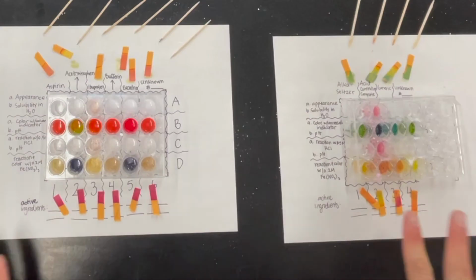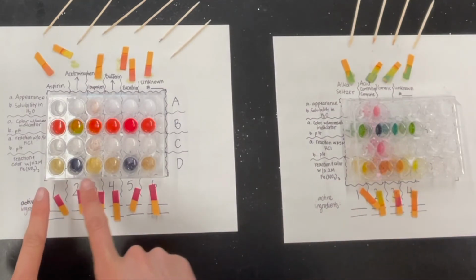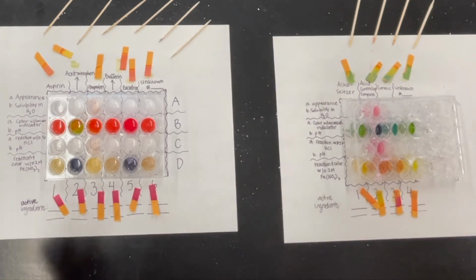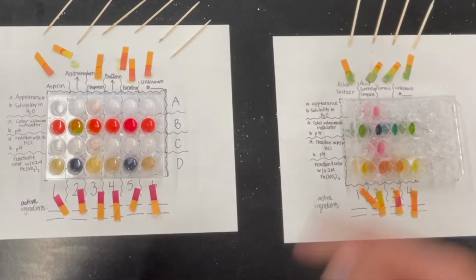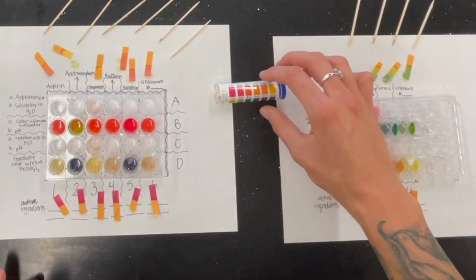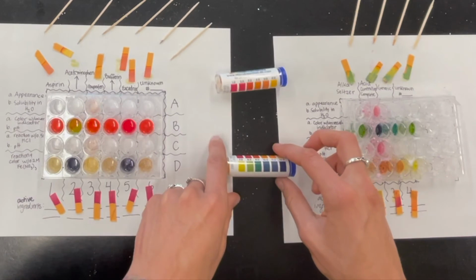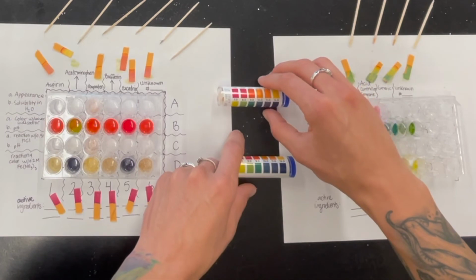Okay, so let's go ahead and let this do its thing for a little bit, and see if these reactions change at all. But right away, you can see that there are different colors abound, right? This is actually a really pretty palette. I tend to like this. Like that strip, I would totally get that in a jewelry, put that on a pendant. Anyways, we're going to let this sit and see how these results change in about 5 minutes. As a comparison, I'm going to leave this here so that you guys have a reference for the pH, and then we'll come back in about 5 minutes and see our final results here.